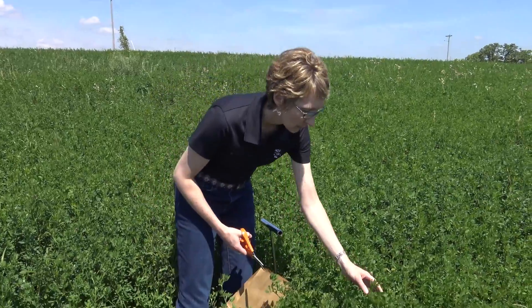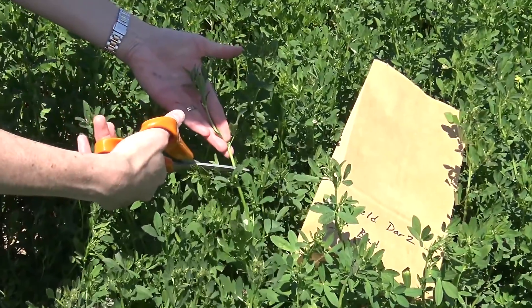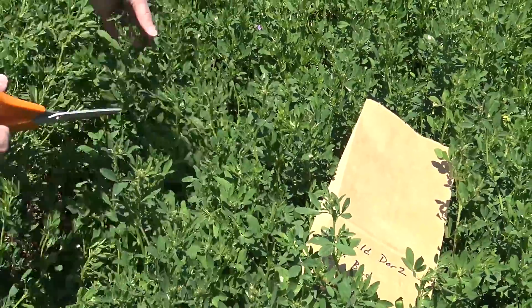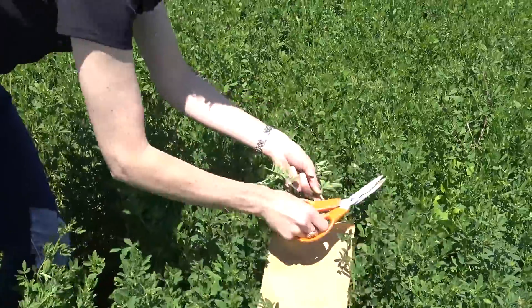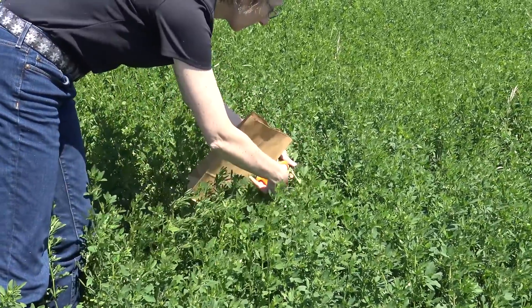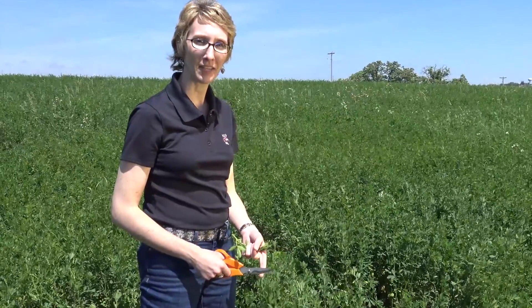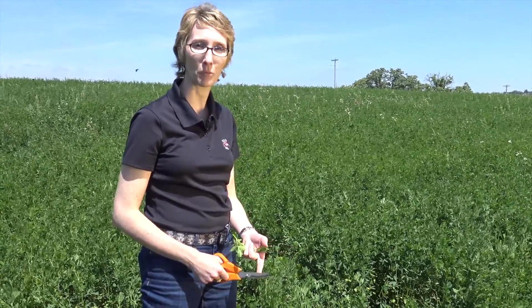When you do the sample, you want to look at your plant. I don't have a ruler with me, so I'm going to judge that my hand is about six inches long and take a sample like that — that was just one. What I need to do is collect 35 tops like this, ideally from 35 different plants. We don't want stems coming from the same plant, because that gets back to having a representative sample. You also want to avoid plants that have insect damage or that are dead — it's not useful to sample a dead plant.